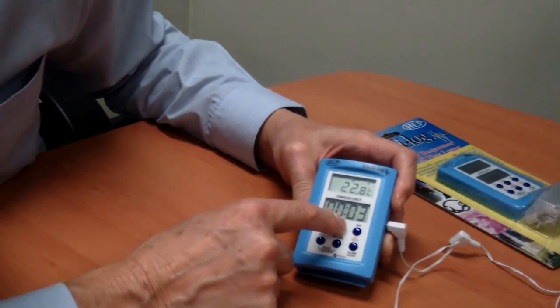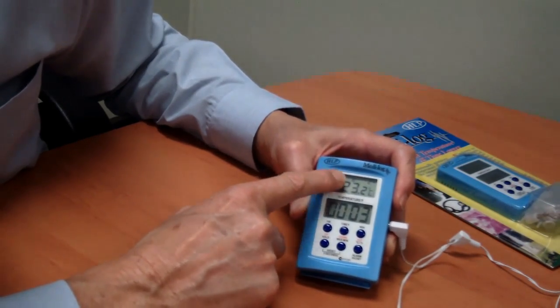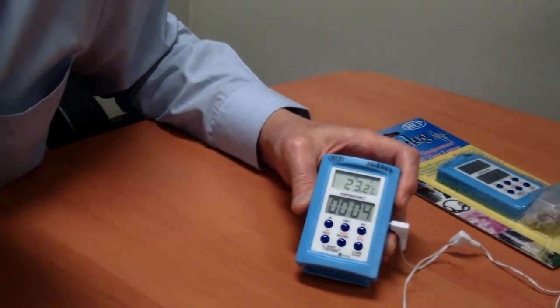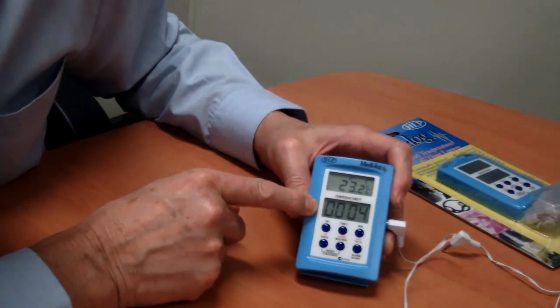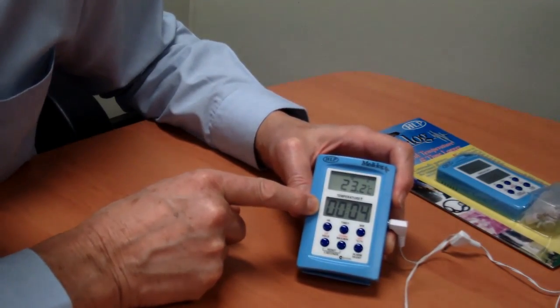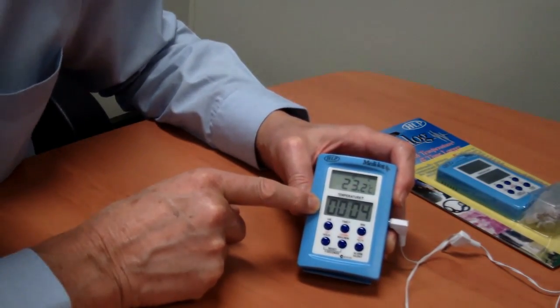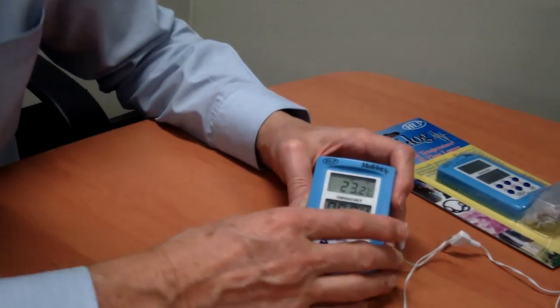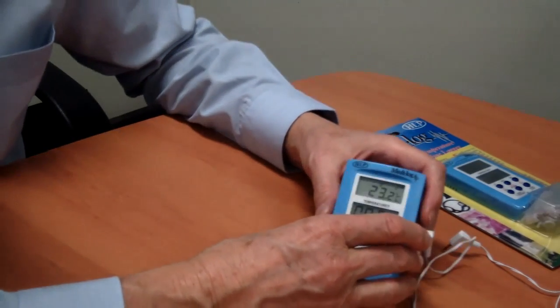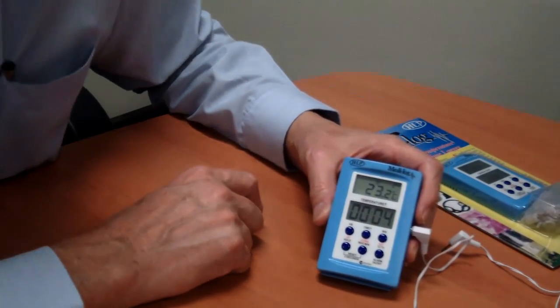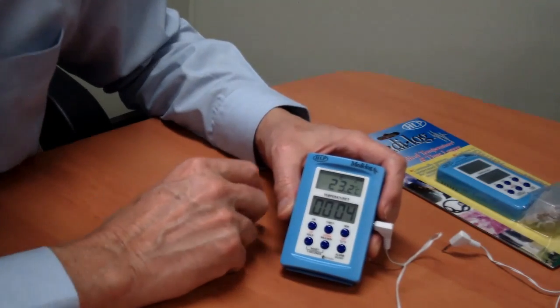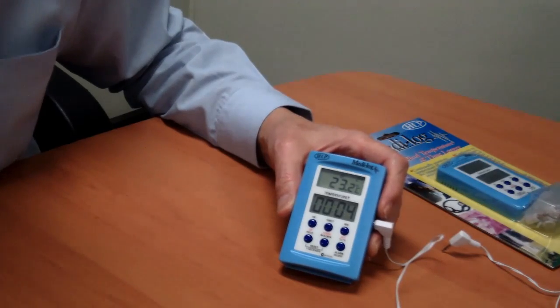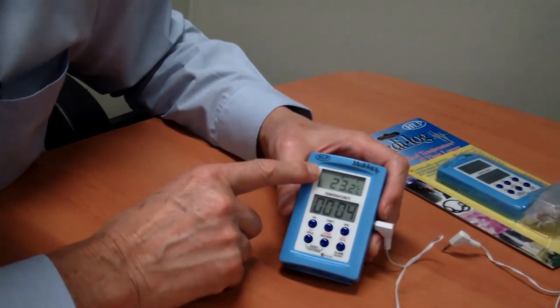If you come into your surgery and the vaccine fridge has died sometime over the weekend, then you need to find out what the maximum temperature it reached and how long it was there. So you can come to this unit, you see it's a high temperature.